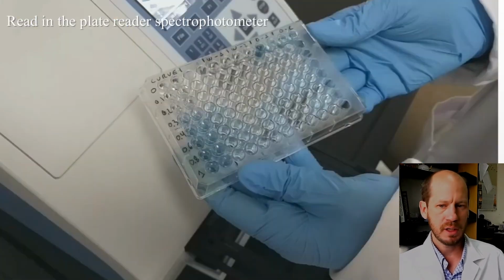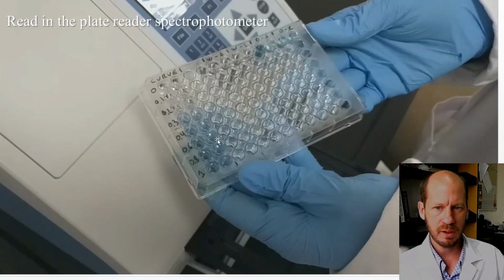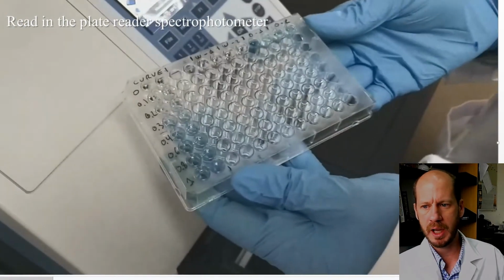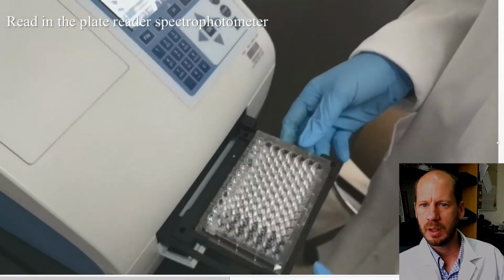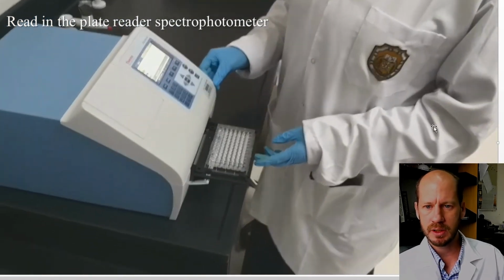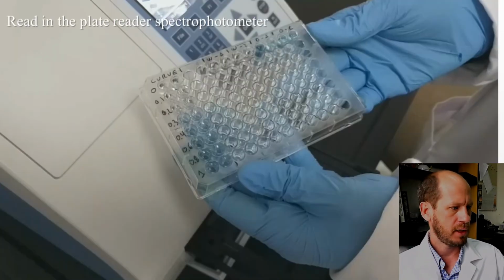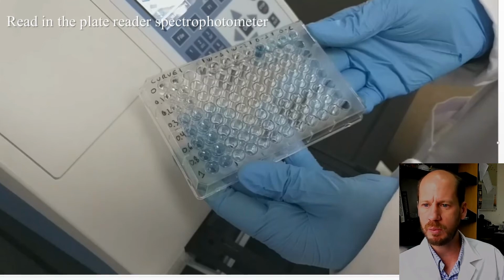Okay. After adding the color development reagent, we leave it 15 minutes for developing color. You can see here the gradient of the curve, and then here are some samples. And then we proceed to measure this on the microplate, on the plate reader at 880 nanometers for this method. And then after that, the calculations will be done similarly to what we did for soil extracts.